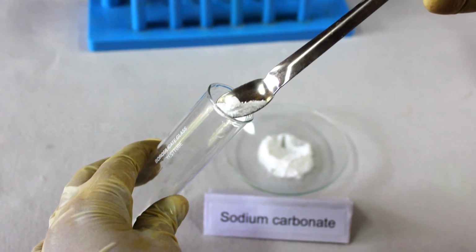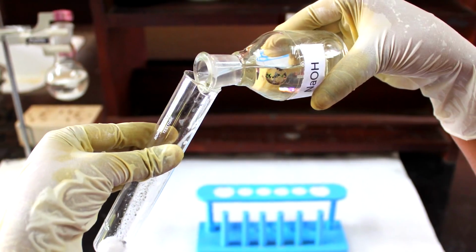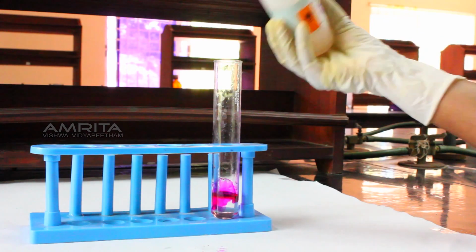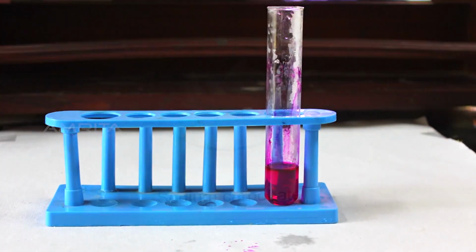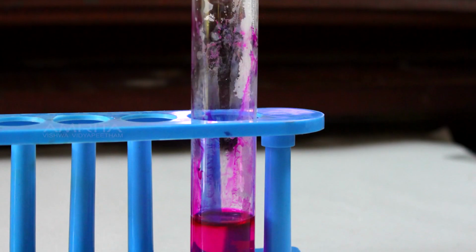Now, add a small amount of sodium carbonate in a boiling tube and add NaOH solution into it. Then, shake the boiling tube well. Add a few drops of phenolphthalein into it. You can observe that the color of the solution turns pink, which indicates that sodium carbonate and NaOH do not react but form an alkaline solution.